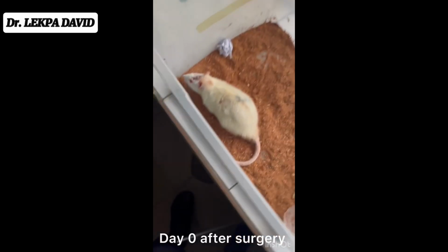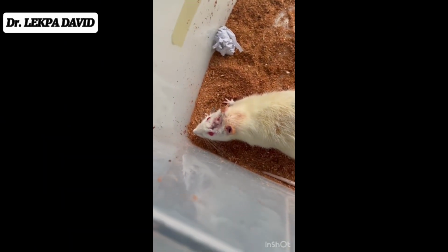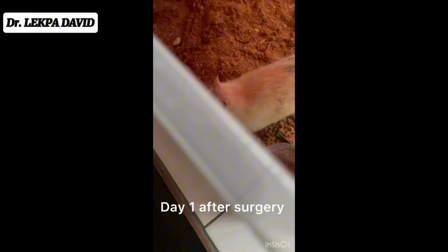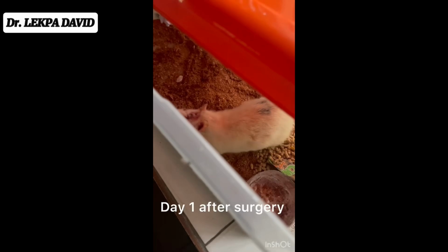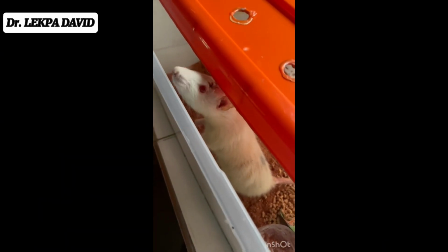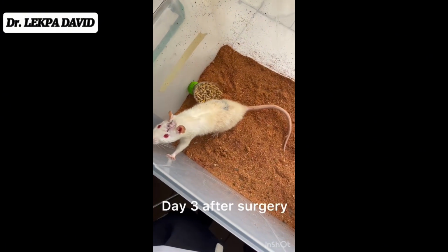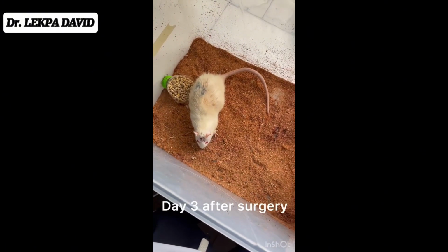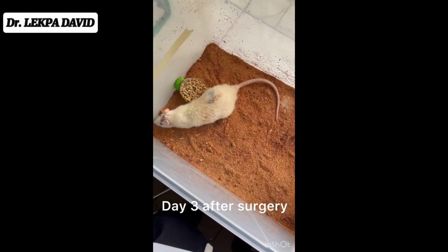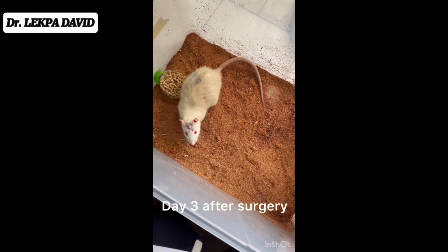Now this is day zero, just immediately after the surgery. This is the rat after the surgery. This is the next day. Now we gave antibiotics to the rat to help recovery, to help the healing process. And this is day 3, and this is clearly showing that the antibiotics are working. You can see the improvement. It's walking around, it's even drinking water, it's actually eating very well as before.